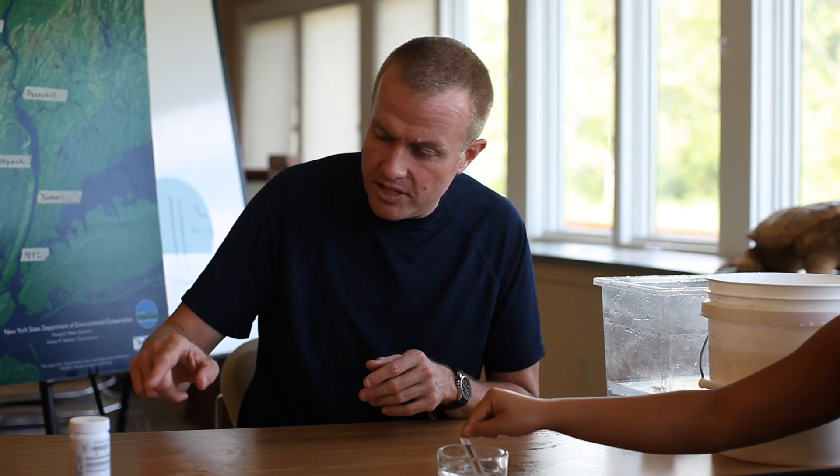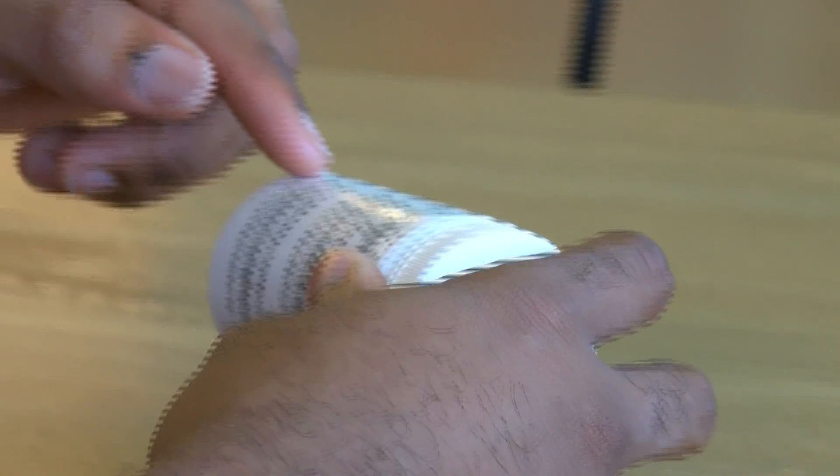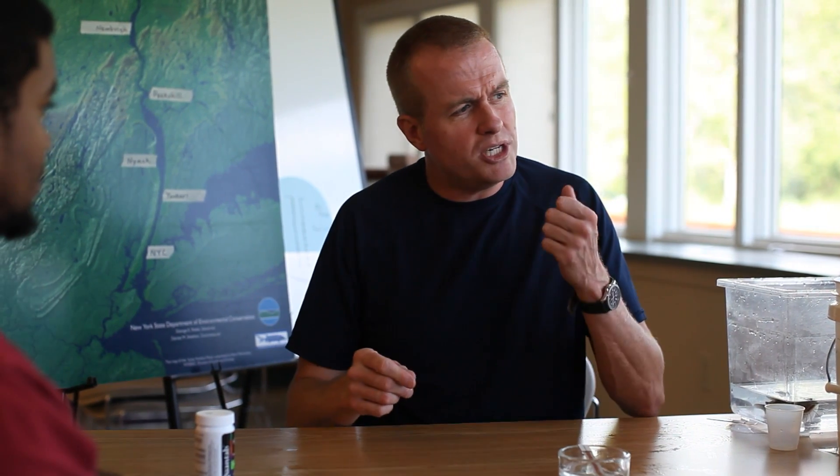With the Quantabs, we're not measuring total salinity the way we do with the hydrometer and the refractometer — we're measuring a significant part of salinity, which is chlorides. The unit of measurement here is parts per million, whereas when we were looking at brackish and saltwater, we were using parts per thousand. So 51 parts per million in freshwater is much, much lower — really a very small amount of chlorides found in freshwater tributaries and even in the Upper Hudson.